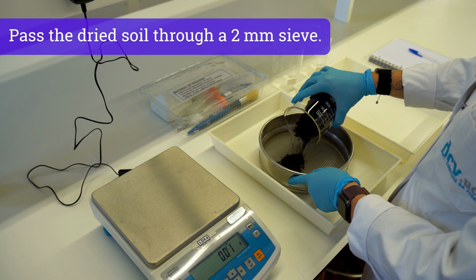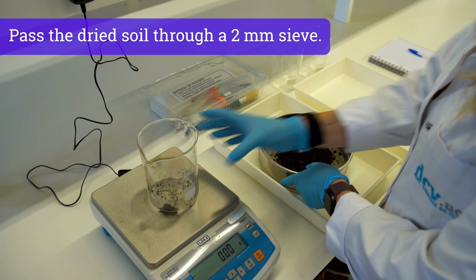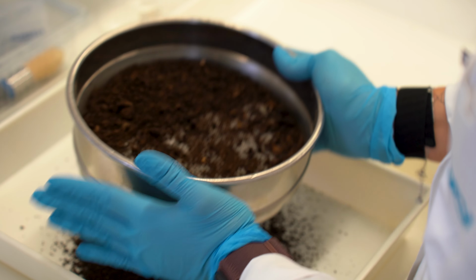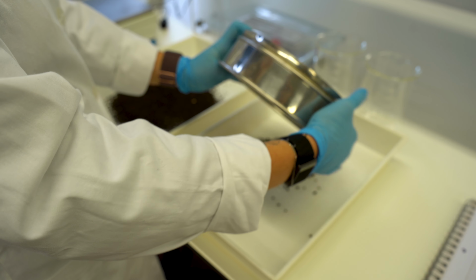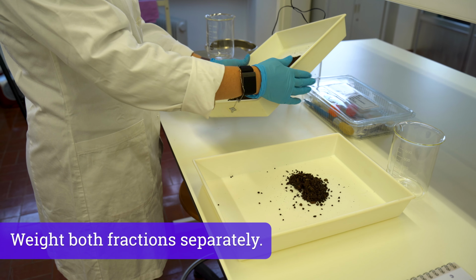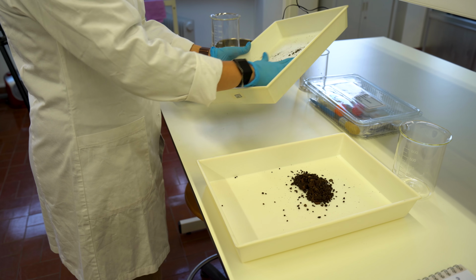Pass the dried soil through a 2 mm sieve to assess the proportion of coarse and fine fractions. Weigh the coarse and fine soil fractions separately and record the weight of both soil fractions.